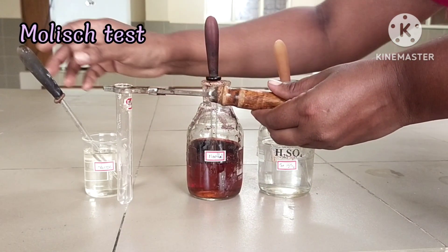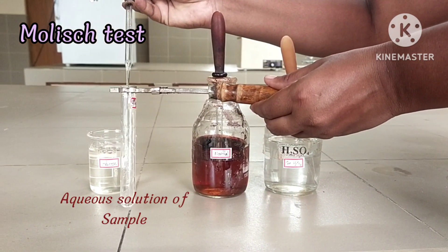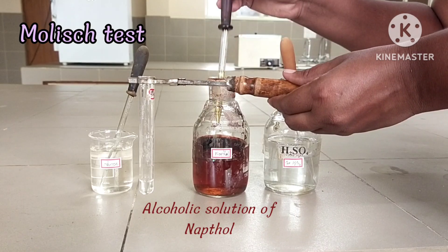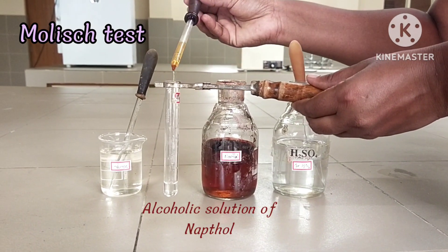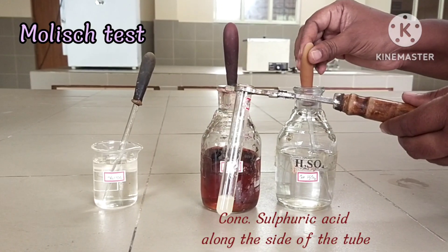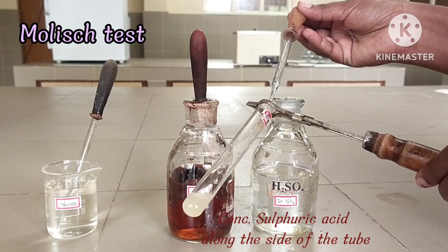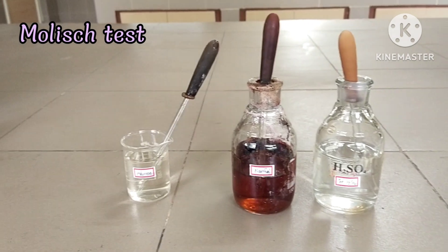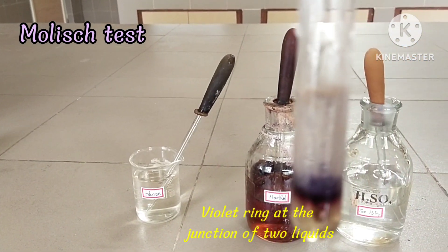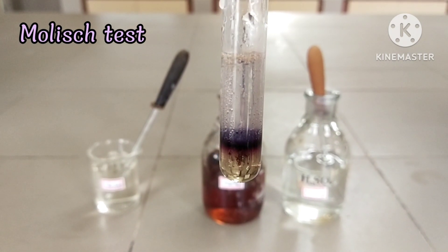Procedure: Aqueous solution or alcoholic solution of the substance or sample is added to a test tube. Then add 10% alcohol solution of naphthol. Add concentrated sulfuric acid alongside the tube. A violet ring at the junction of two liquids is observed — carbohydrates present.